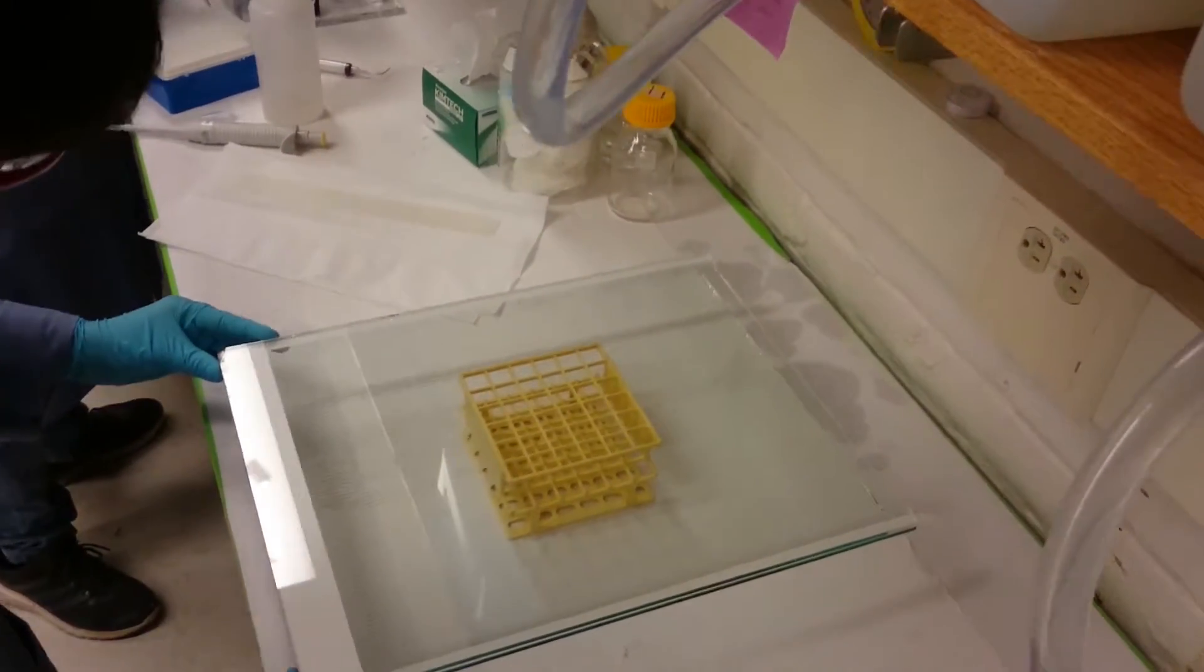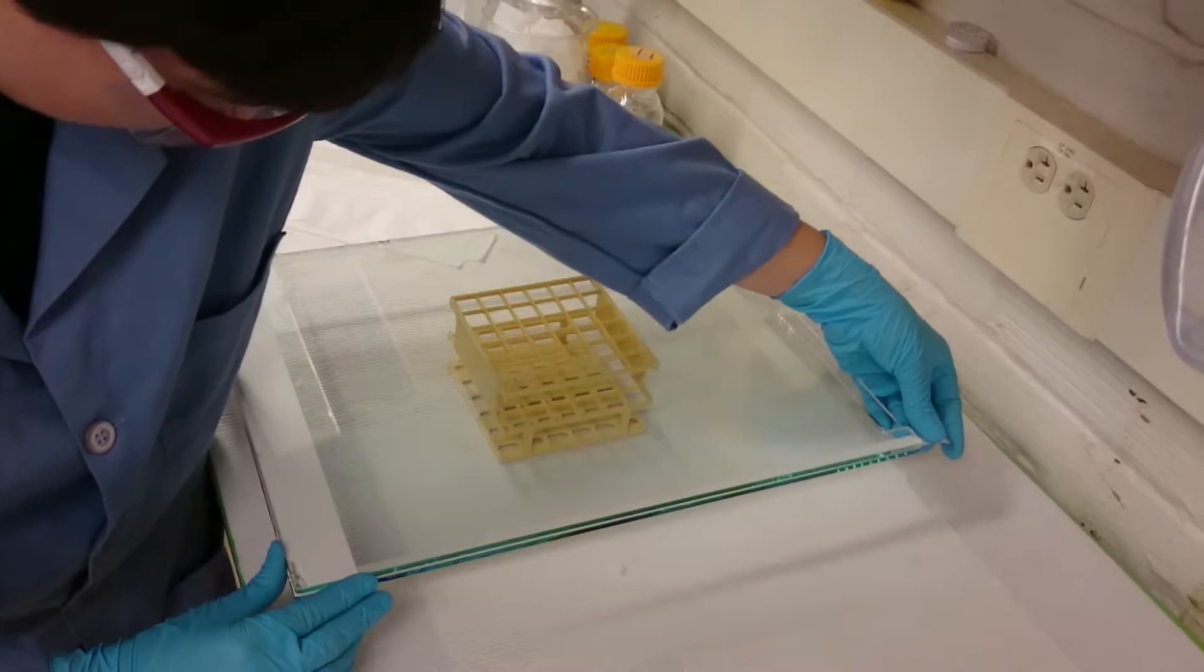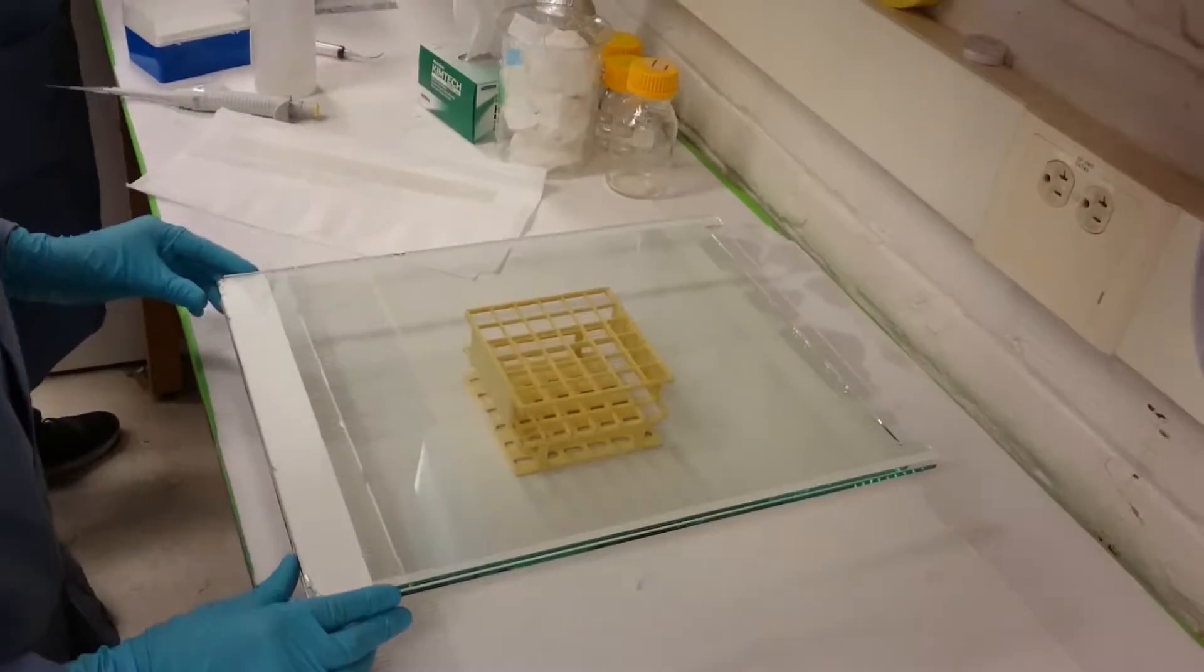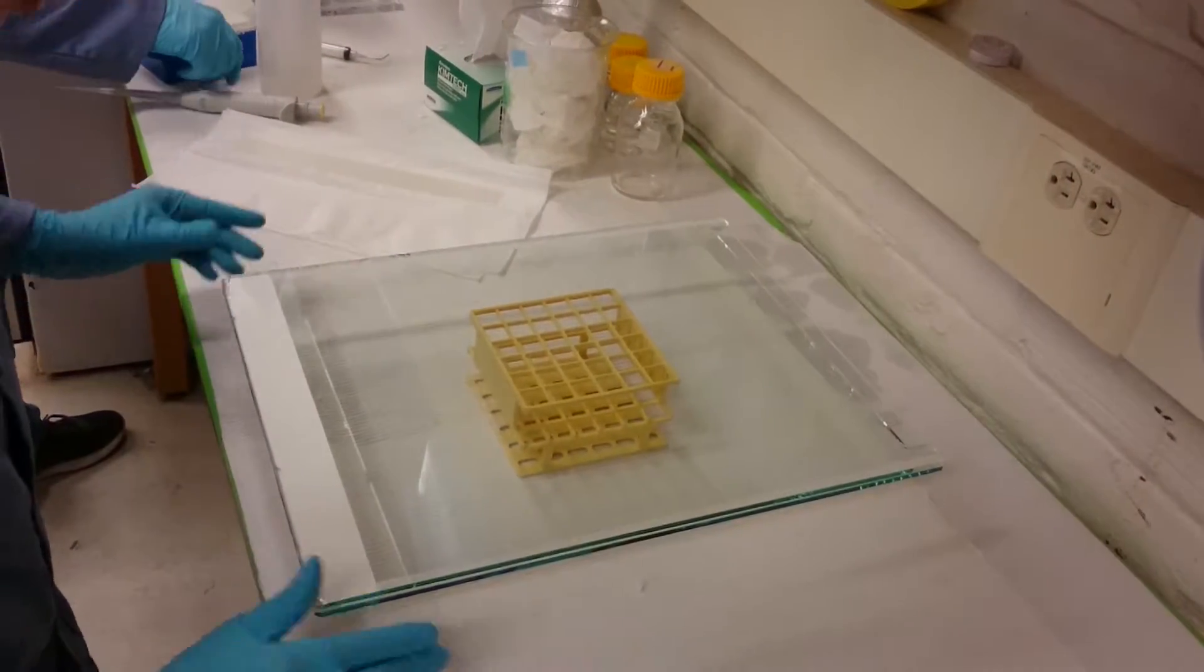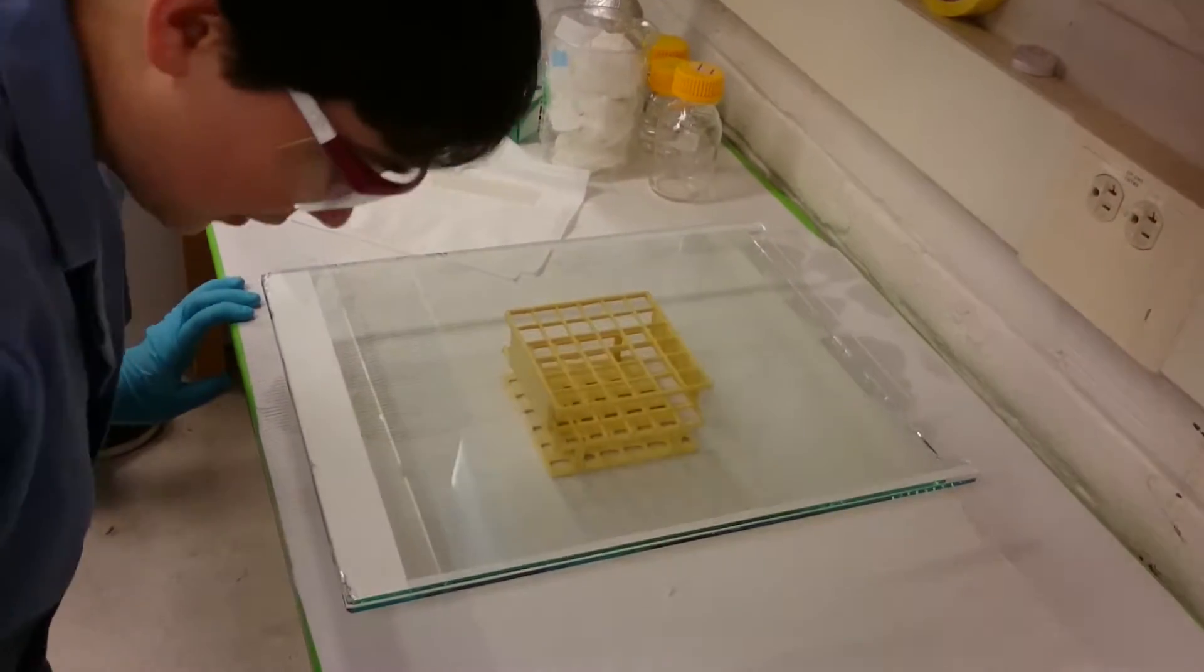All right, now that that's there, I'm just going to readjust the spacers so that they're once again right up against the filter paper because they inevitably move a little bit while you're putting the top plate down. All right, so now I've got that nicely set up.